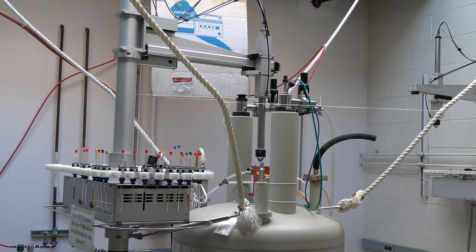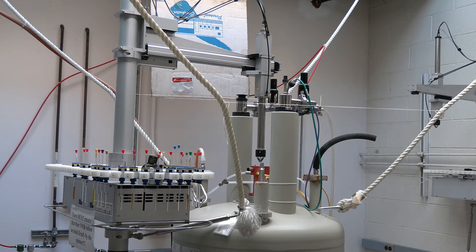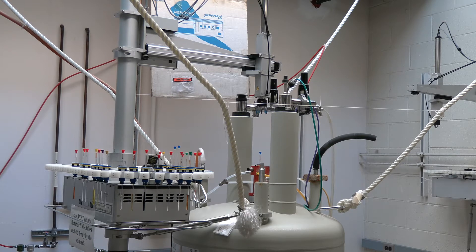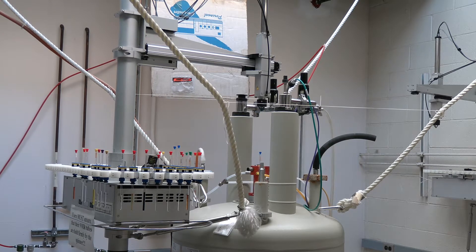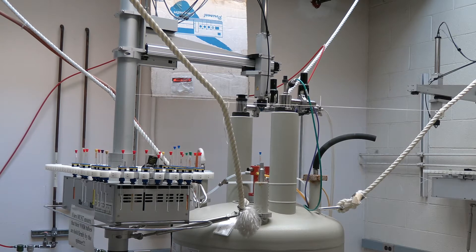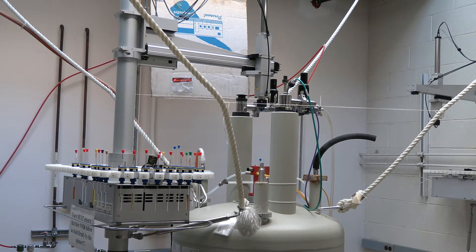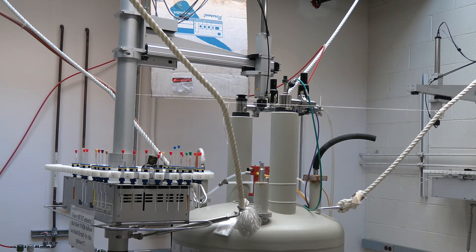Before placing your samples on the carousel it's a good idea to double check that your NMR tube is at least 16 centimeters tall and is no taller than 27 centimeters. If the sample is taller than 27 centimeters the arm will end up pushing your sample down in the spinner, ultimately affecting where your sample sits inside the instrument. This will not only affect your spectra but could also damage the instrument.